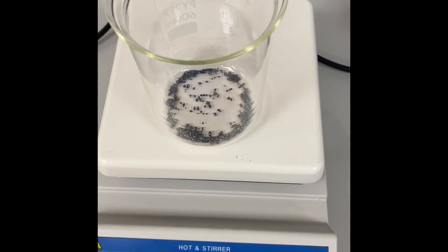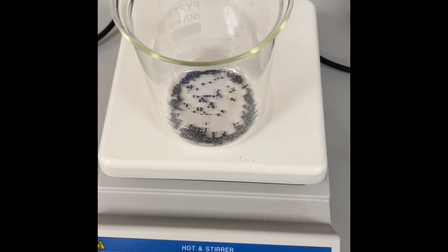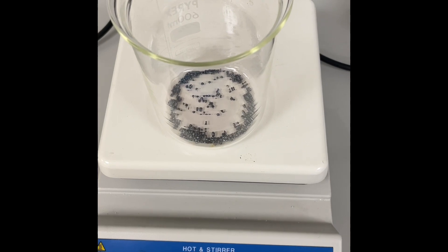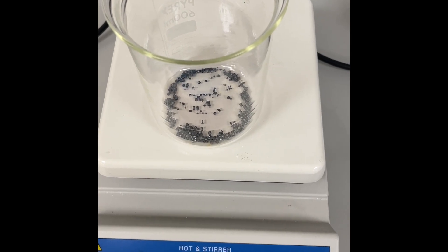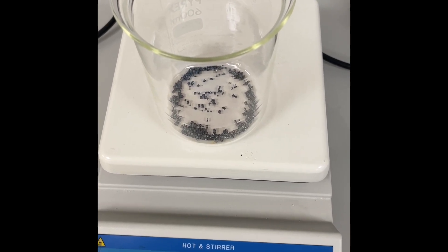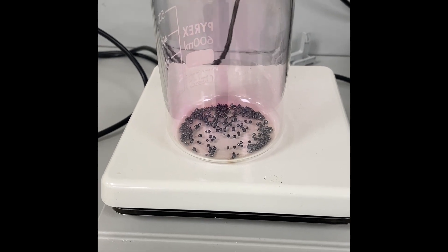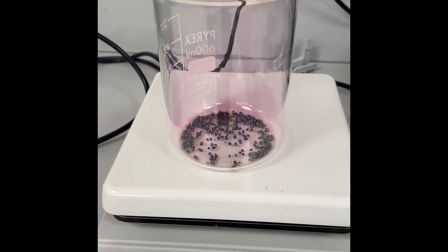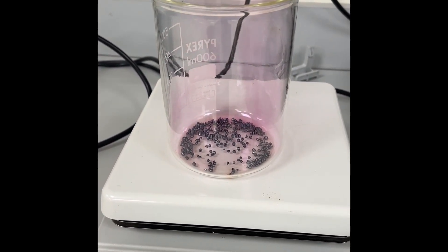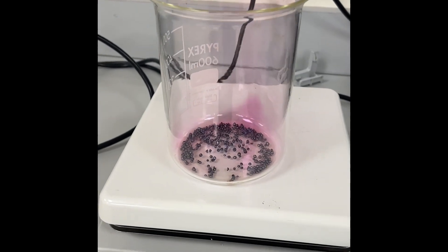Now I'm keeping this iodine on a hot plate to help it change state from solid to vapor. You can now see some purplish vapors coming from the iodine when it gets heated.